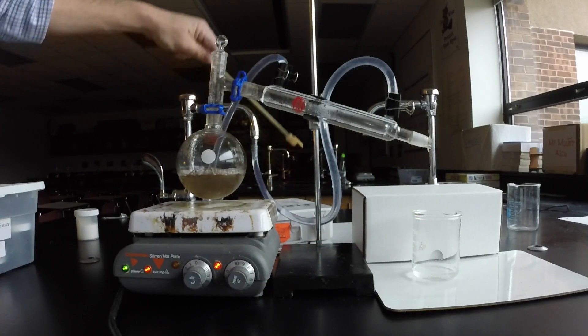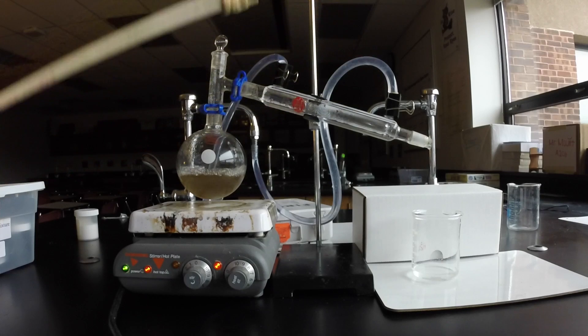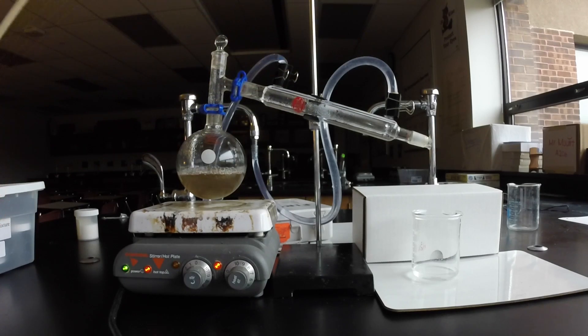Water from the tap, cold water, runs through the condenser. So remember that distillation separates the components of a mixture by boiling point.